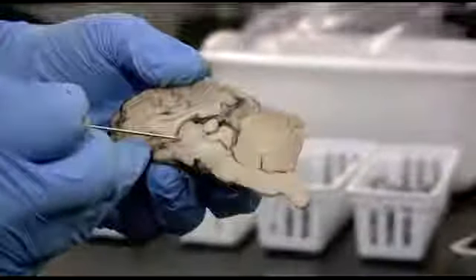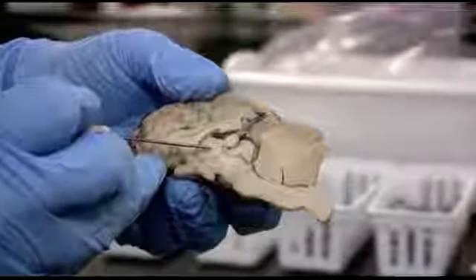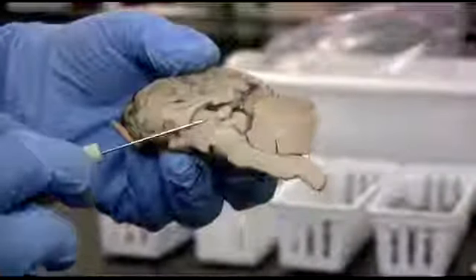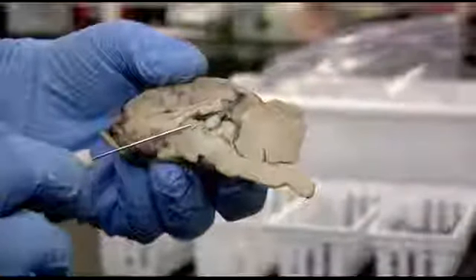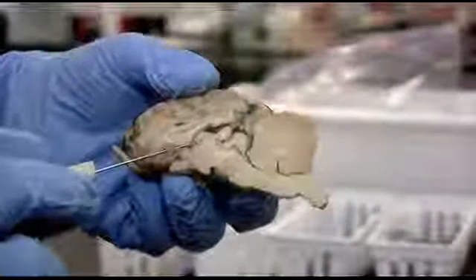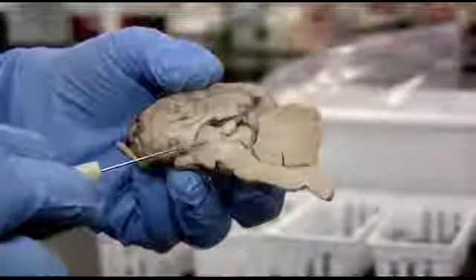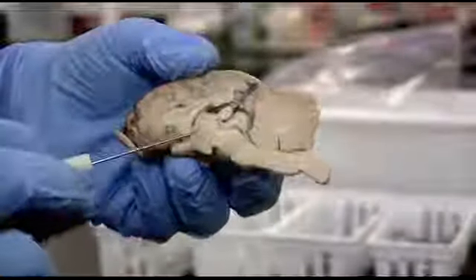It's a very circular bit of tissue, and that is the thalamus. Remember, there are two sides, a left and a right side, so if we cut straight down the center, we would say this is where the two thalami meet. The interthalamic adhesion is that part we talked about that's missing in 30% of males, the connection between the two sides of the thalami. But it's a very good landmark when you're looking at a sheep brain that doesn't have a lot of differences in the tissue. It just looks like a big blob of tan tissue. So if you have the circle, that's the thalamus.